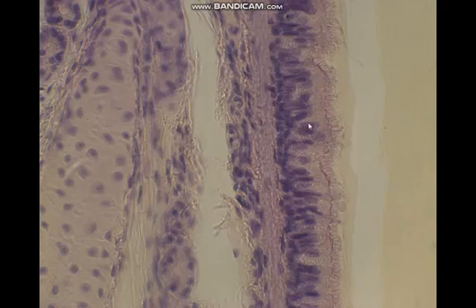Pseudostratified epithelium, in which we can see different rows of nuclei, all of them raised on a basal lamina, not all of them reaching the free luminal surface. On the free luminal surface, we have specific projections. These are the cilia. So this is ciliated pseudostratified columnar epithelium, which is a respiratory epithelium found in the trachea. This is a trachea, this is the epithelium, and this is a piece of hyaline cartilage of trachea.